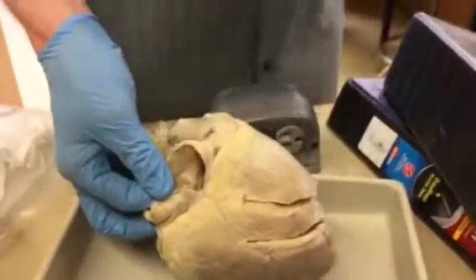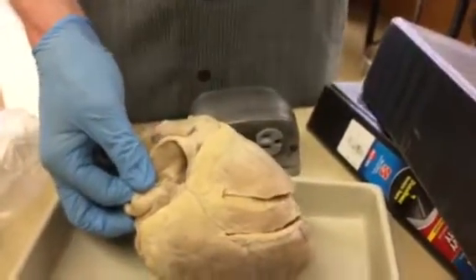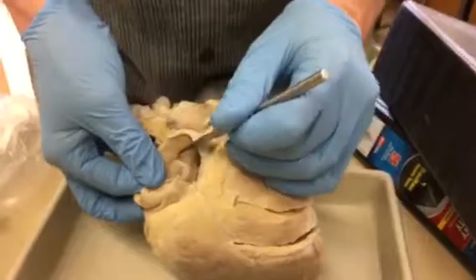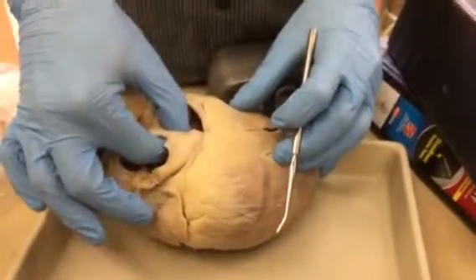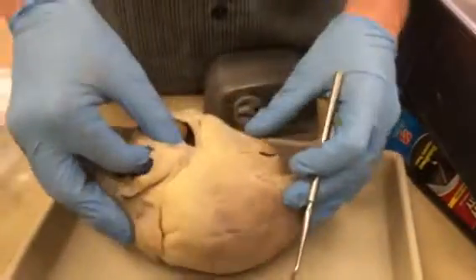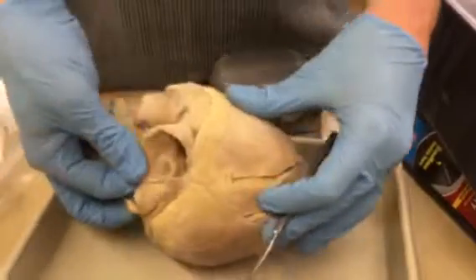Okay, so one structure's in the fetus and one in the baby. Okay, so now we've got that. So fossa ovalis, and that's right in between the 2 atria, right? Each atria is on that side. So this thing is the interatrial septum, and in that septum is the fossa ovalis.